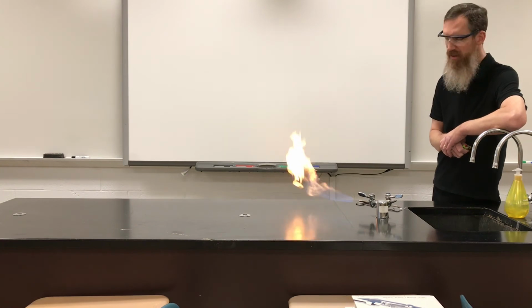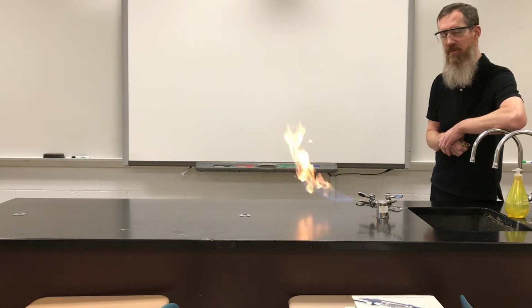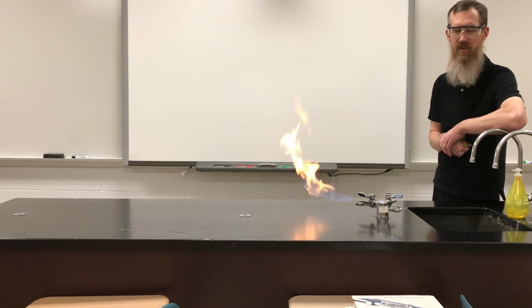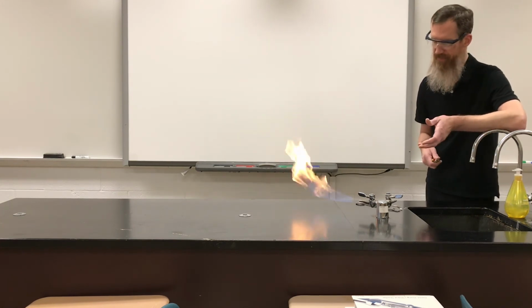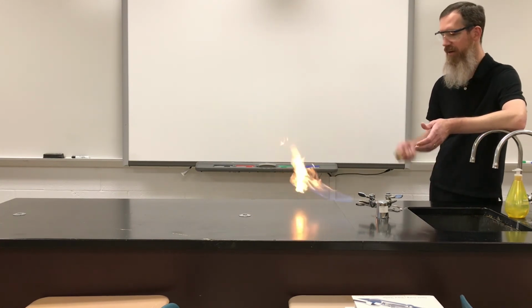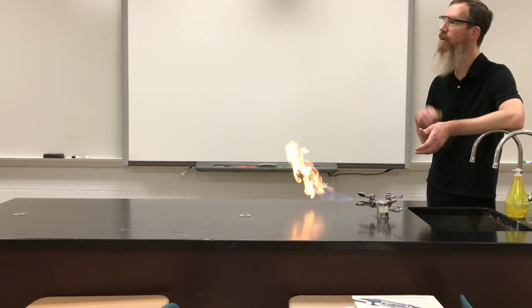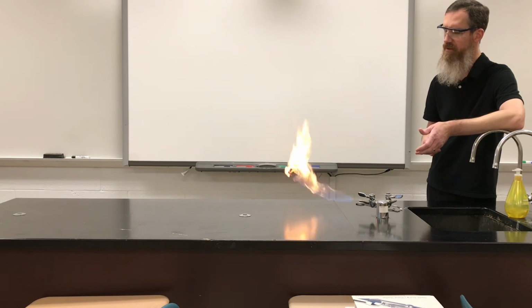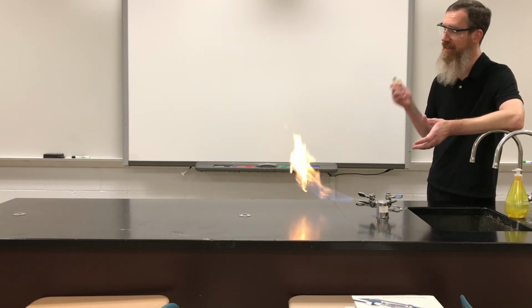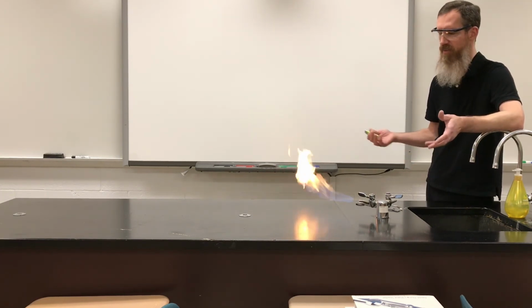And you might be familiar with this from other background information, but when you burn fossil fuels, one of the things we worry about in today's society is carbon. They say carbon. How much carbon are we putting in the atmosphere? When we burn fossil fuels, we put out carbon dioxide. We breathe out carbon dioxide. Burning creates a lot more carbon dioxide. And that carbon dioxide, again, is a concern going up in the atmosphere and enhancing global warming. So that is one of your products. Now you can't see carbon dioxide because it is a clear, colorless gas and it's floating away. And there's already carbon dioxide in the atmosphere. That's what plants use to live.